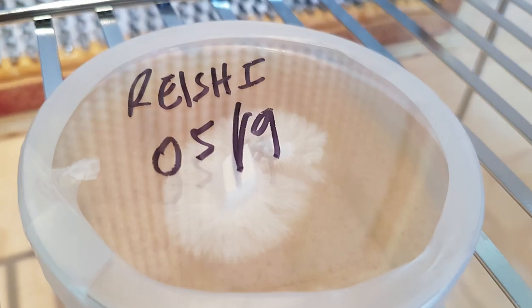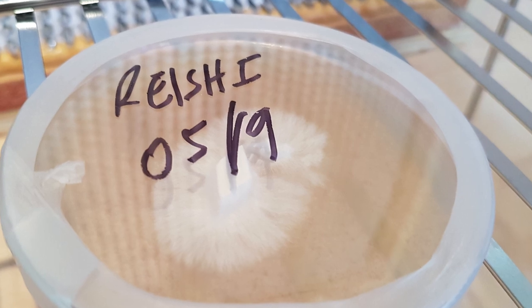You can use these plates later to make grain spawn, to make more agar dishes, to make culture slants, or just to store them for long-term storage of the mushroom culture. We're going to watch over the next couple days as this mycelium starts to jump off the initial piece of agar and work its way throughout the dish.